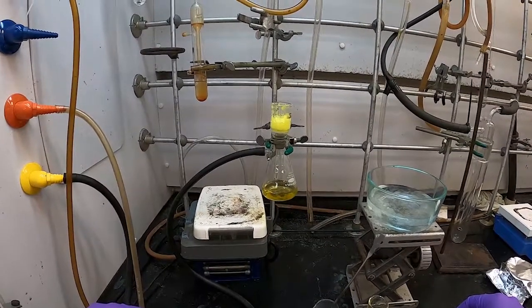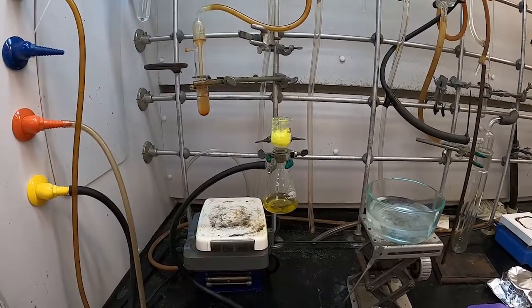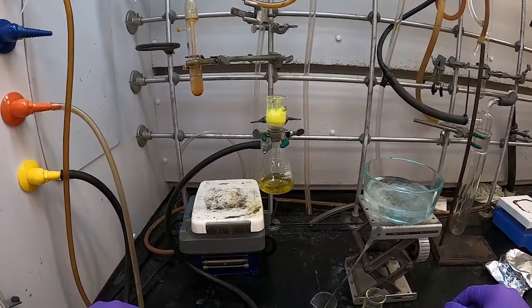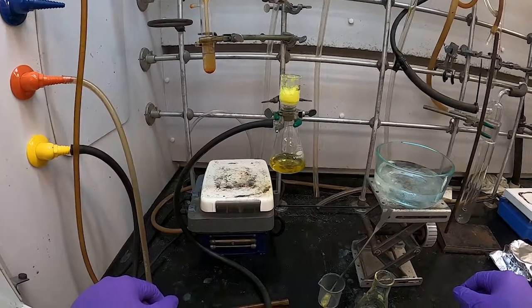And we'll let that dry on the vacuum. Once that's nice and dry, we'll scrape it into a vial and see how much we got.